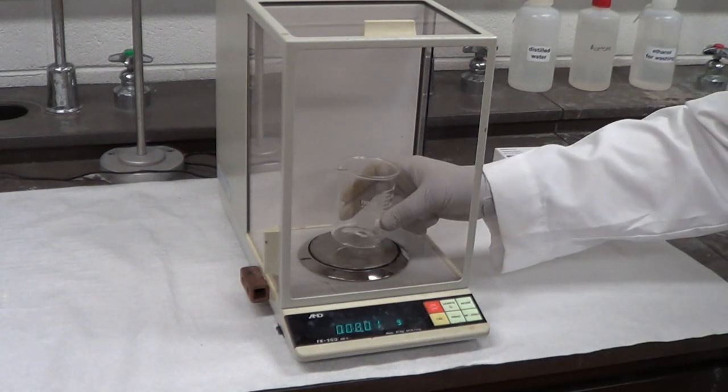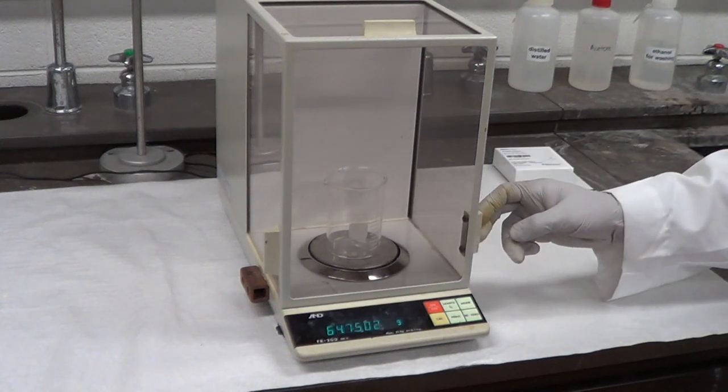Press the tare and then place the beaker. We will record the weight in our lab notebook.